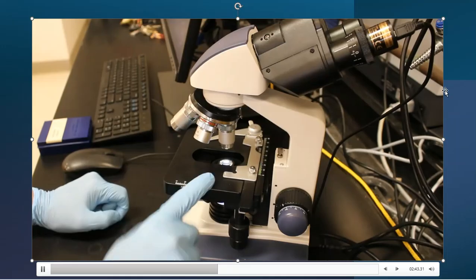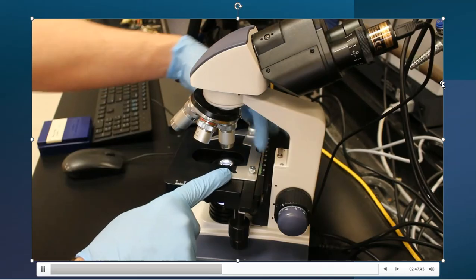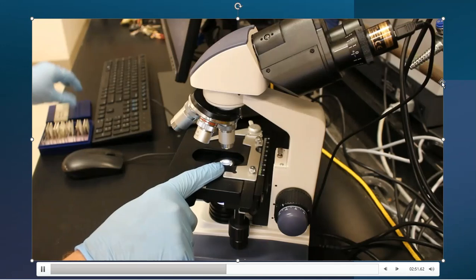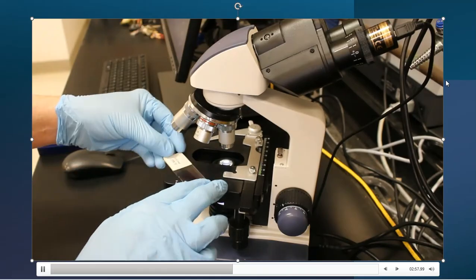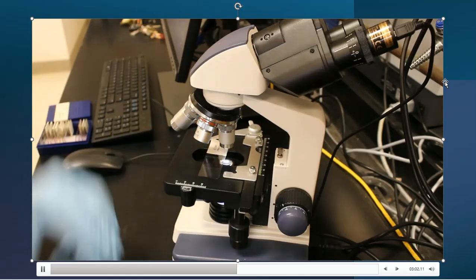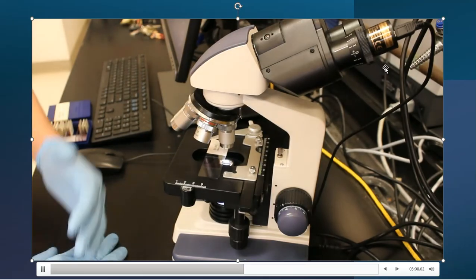All right. Next up is the platform itself. So this silver piece that you're seeing right here, this is where the slide will end up going. So for instance, here is a blood slide that I need to analyze maybe. And what I will do is I'll lay the slide down just like this. It doesn't really matter which end that you do. We've labeled one side, but you know, we're going to have to shift it around and make sure that it's going to work the proper way anyway.